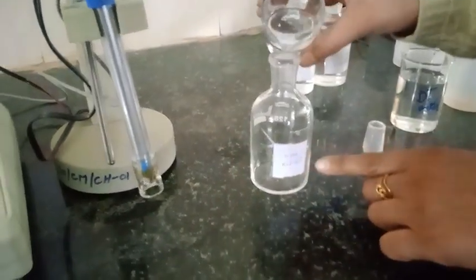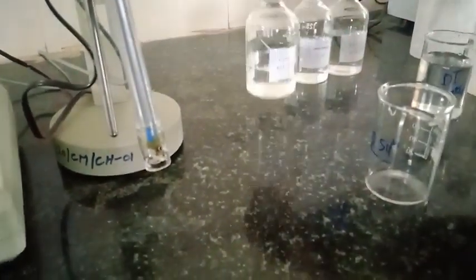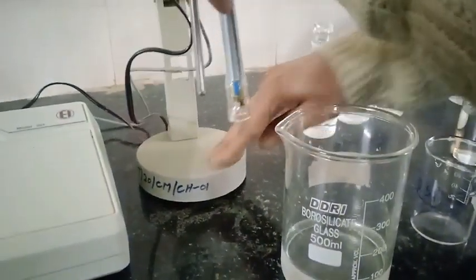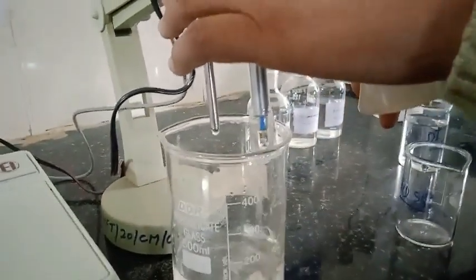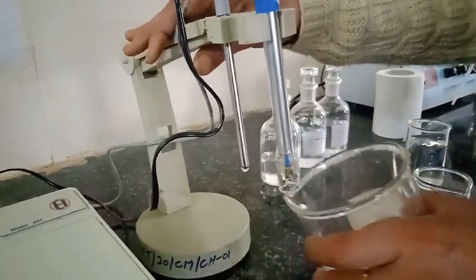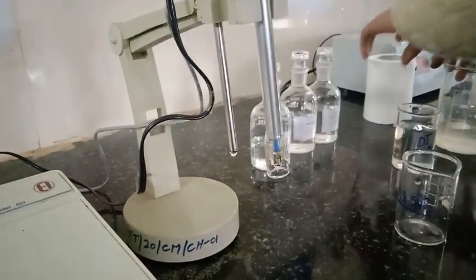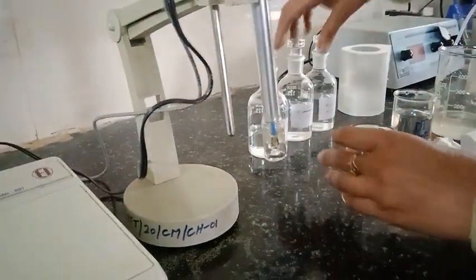I am just going to transfer the solution further into the reagent bottle. These solutions can be kept for at least one month. You need to calibrate your conductivity meter regularly so that your results will be accurate. Now I am going to wash the conductivity cell and the temperature probe thoroughly. The temperature probe measures the temperature of the solution — if you don't have one, you can use a thermometer instead. Now we are going to transfer the 0.02 molar solution into the beaker, but before transferring the whole solution I am just going to rinse it first.